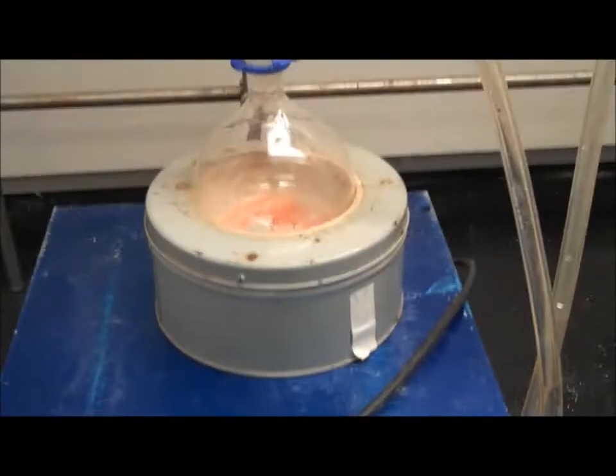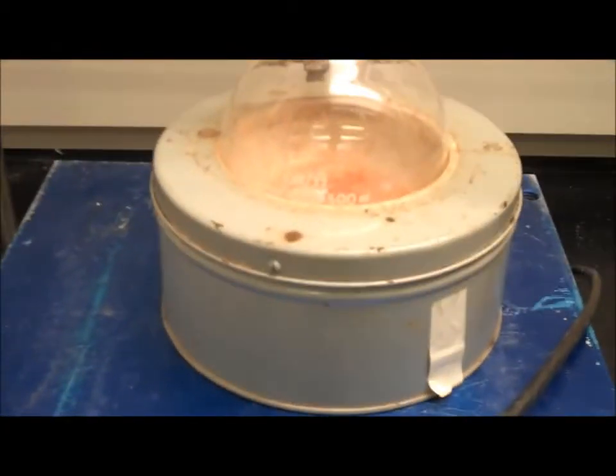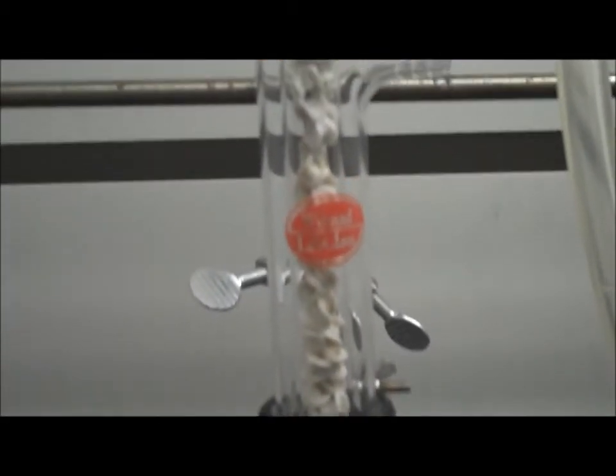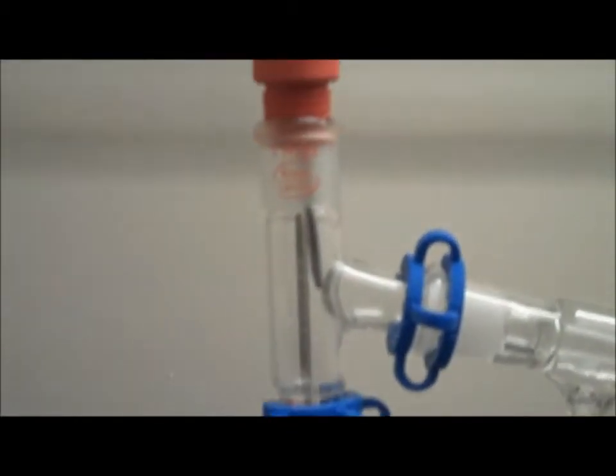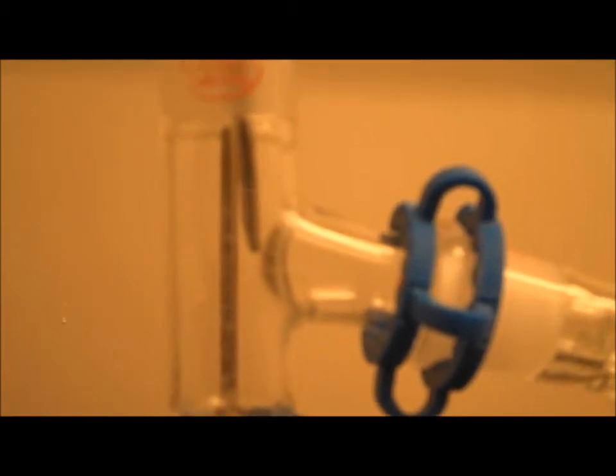Here we have our complete apparatus. Starting at the bottom, I'm going to slowly go up to the top. Make sure your thermometer tip is right at the point where the condenser meets, to get the correct temperature readings during your fractional distillation.